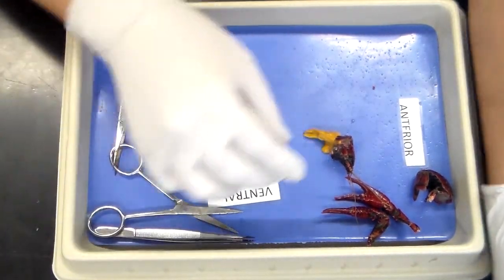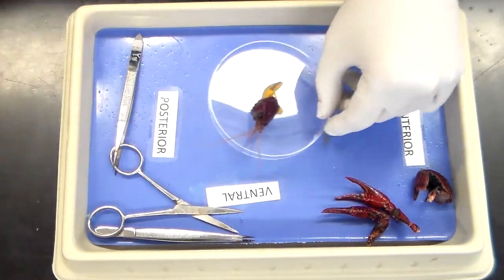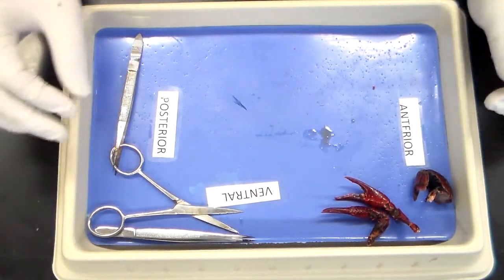The head I'm going to place in a petri dish, and I'm going to squirt some saline solution. We'll now observe this underneath the stereoscope — the dissection microscope — to look at the internal structures. We'll set aside the external anatomy for later.